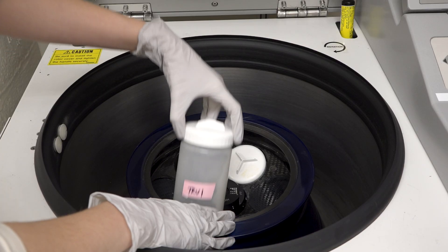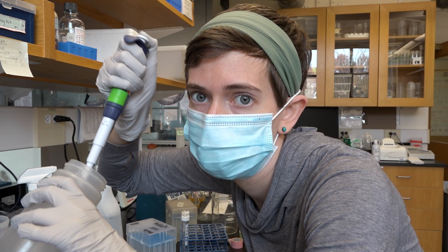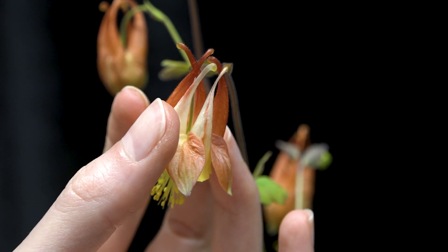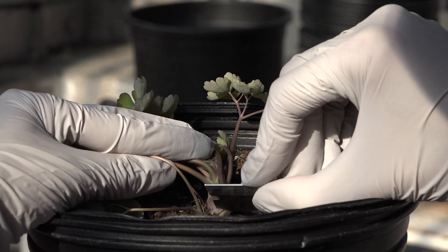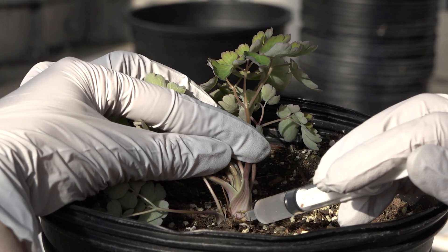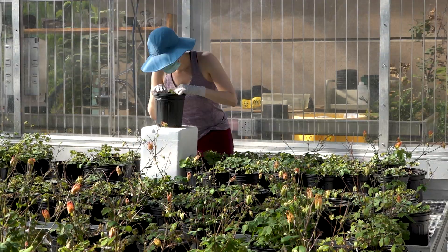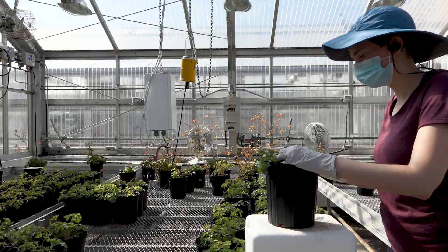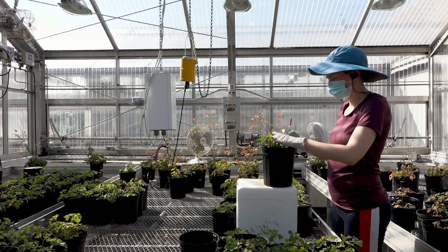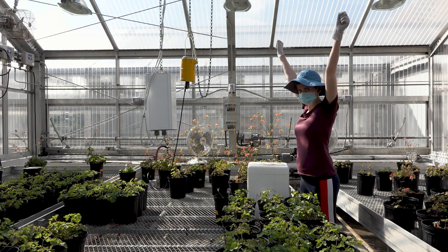Unlike Yan's protocol, which will result in an entire plant that is transformed and able to pass the transformation to its offspring, the best you could hope for with VIGS was a few flowers with partial transformation. The protocol was super labor intensive — I had to inject Agrobacteria into hundreds of mature plants for weeks to get a result, and anytime I needed more flowers I had to do it all over again. On top of that, you could only turn genes off — you couldn't add new genes like GFP. So that's why I am so excited about the transformation protocol that Yan is developing.